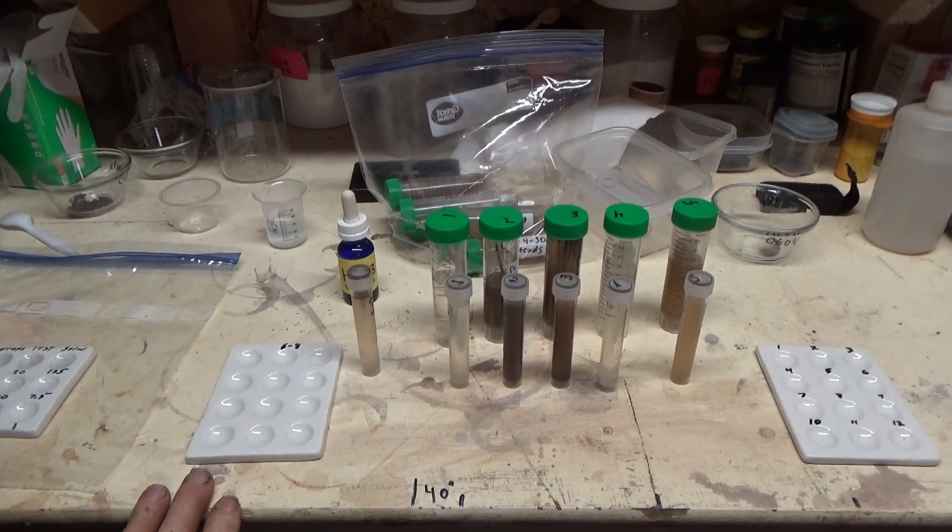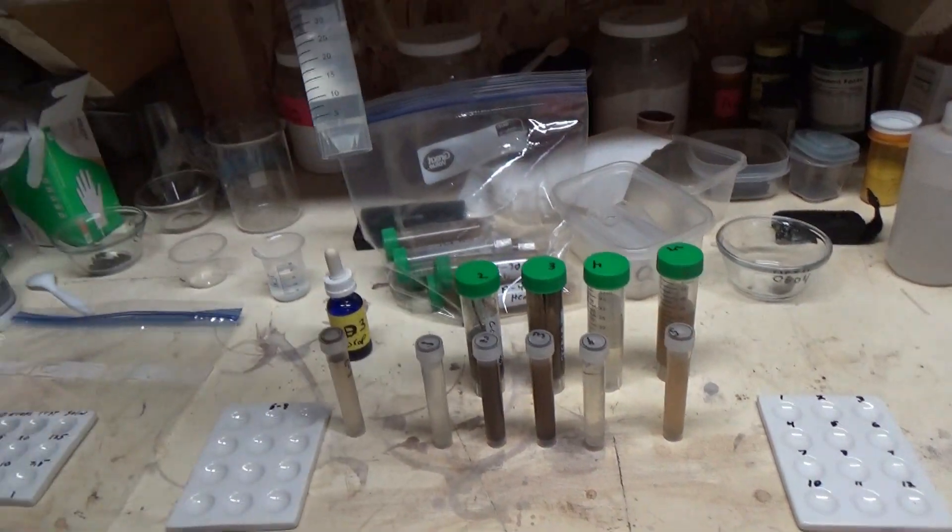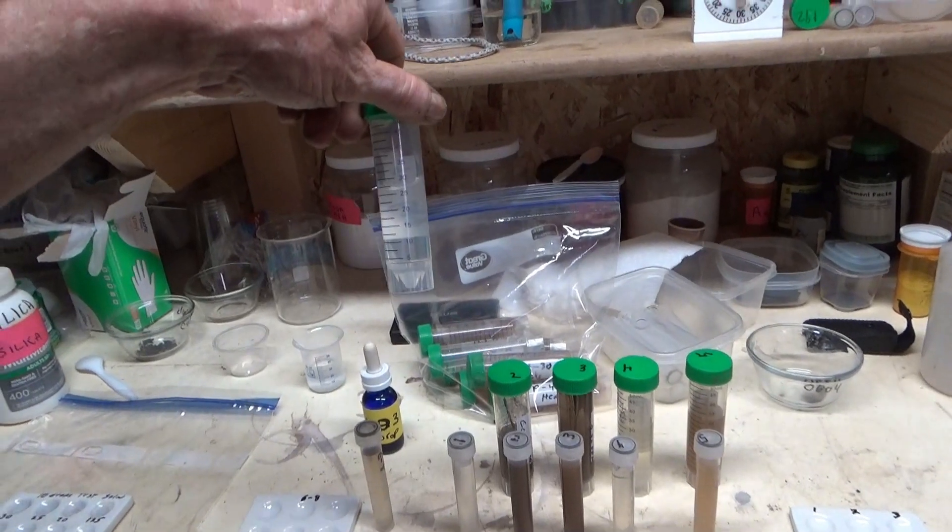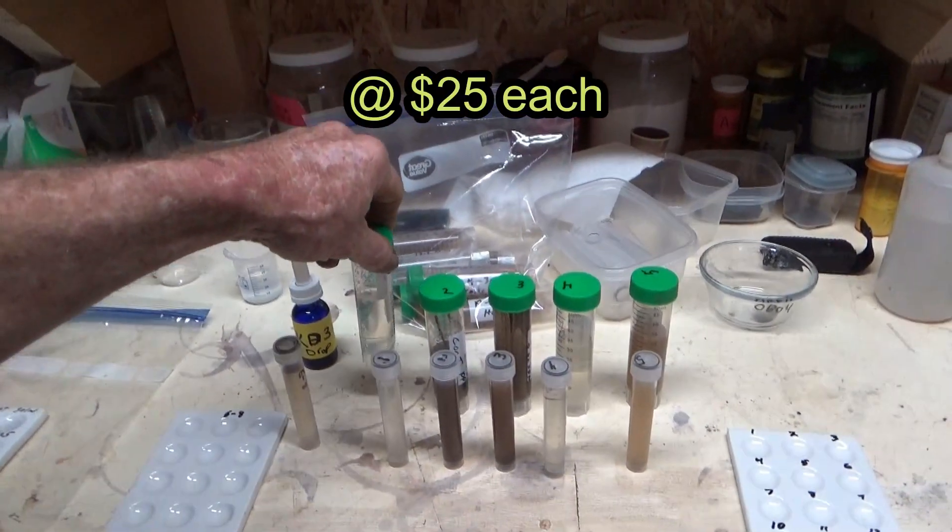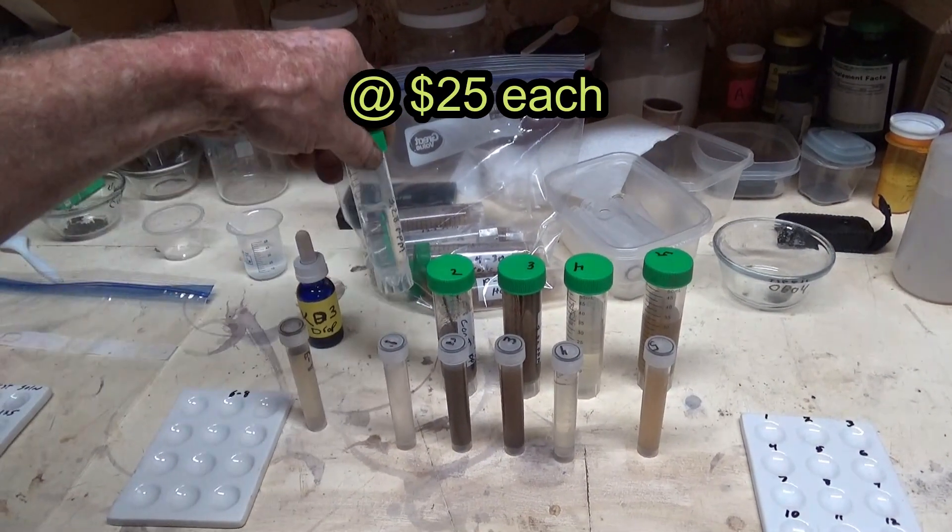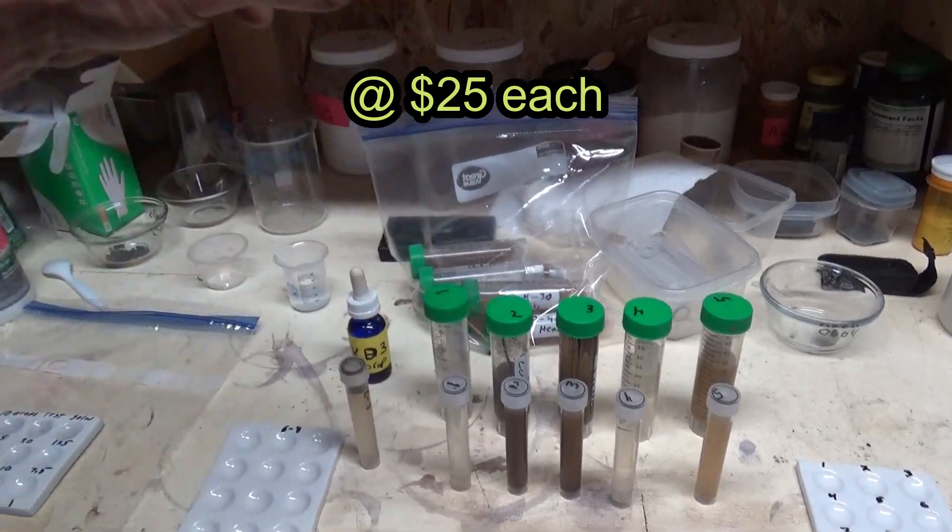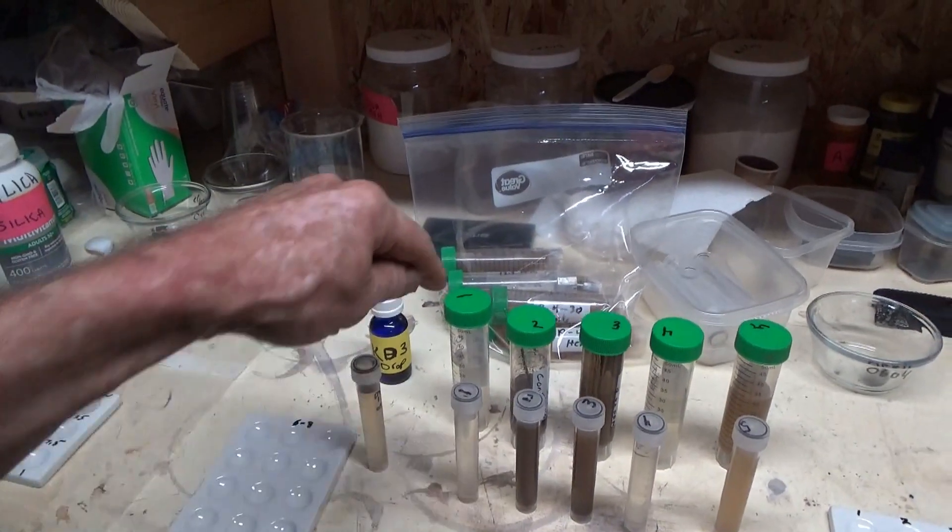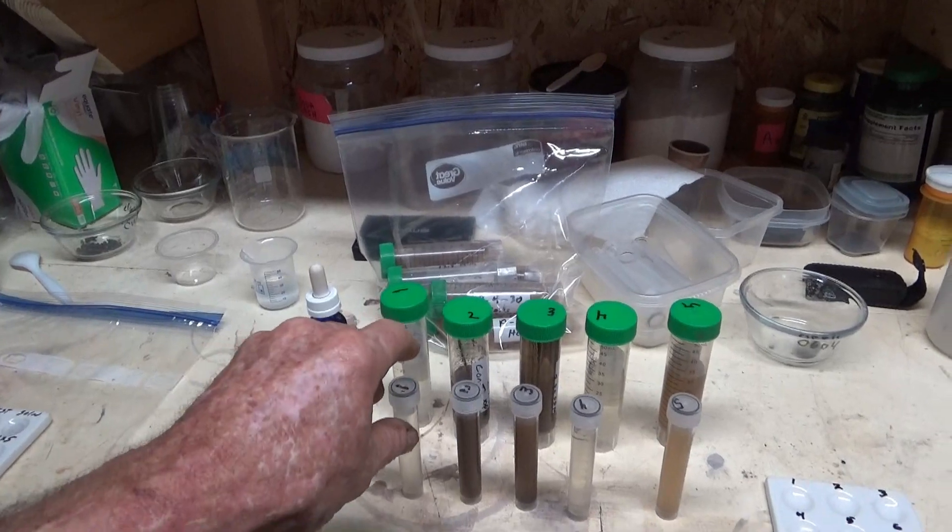Now these samples here were all sent to the lab for analysis and I've got written on them the actual concentration, but I just put a number on top of each one.